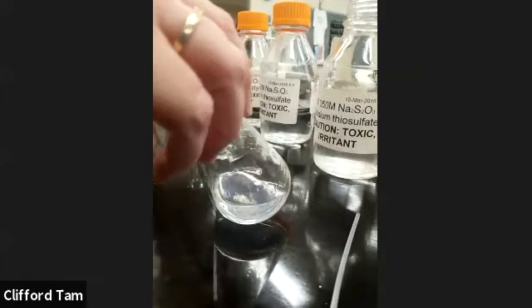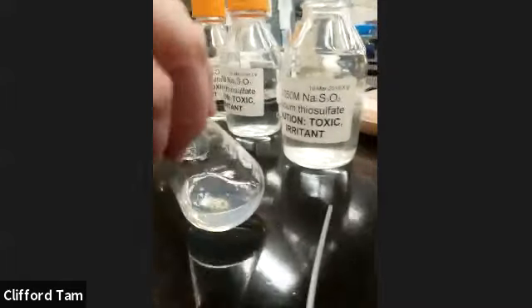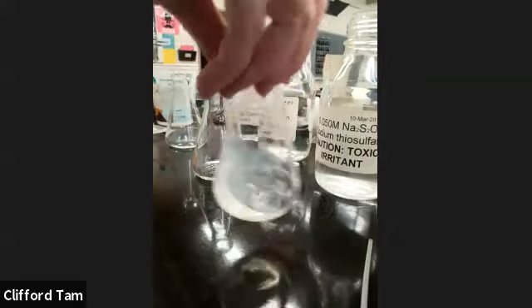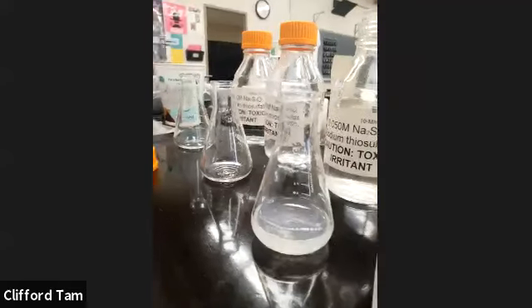Okay, can you see it or no? Yes, it's pretty beautiful. Okay, so this is what it looks like. Can they see it? Yeah, they can, it's very nice. So that's at around 43.46 seconds. Okay, perfect. Great. There you go, Xantha. 43 seconds.